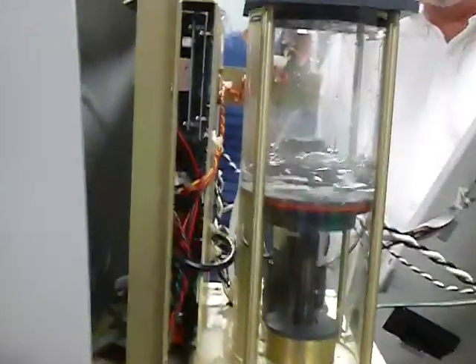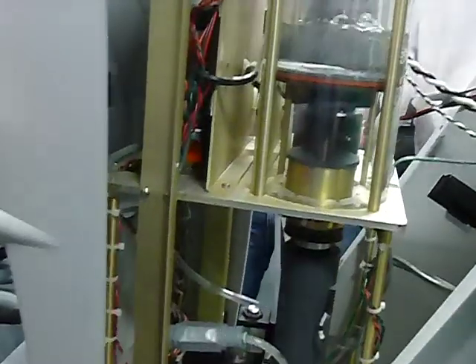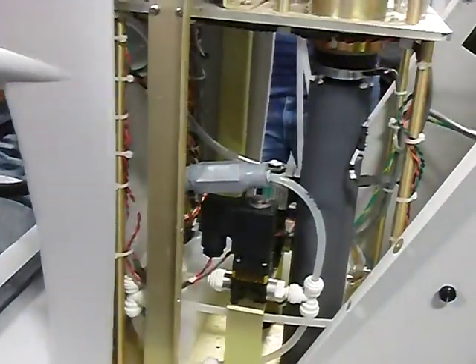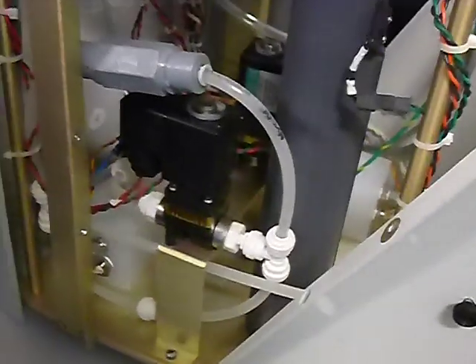All right. So this is creating the vacuum coming in, right? It's sucking it in, the solenoids are opening up, it's going through the heater. How many heaters are there? 2 heaters, okay? You don't press it at the same time. Yeah.